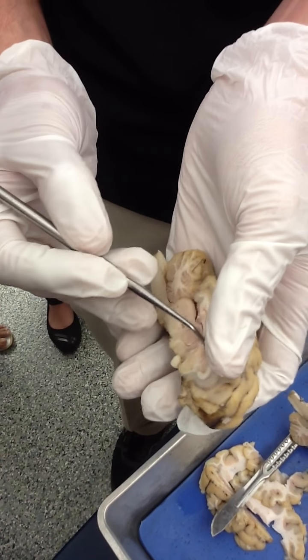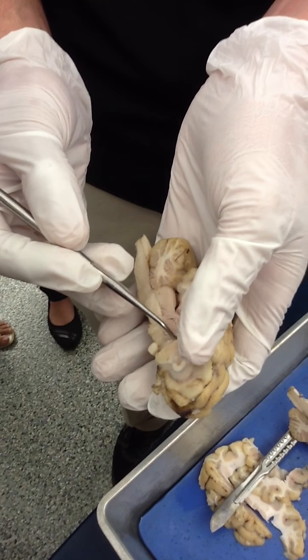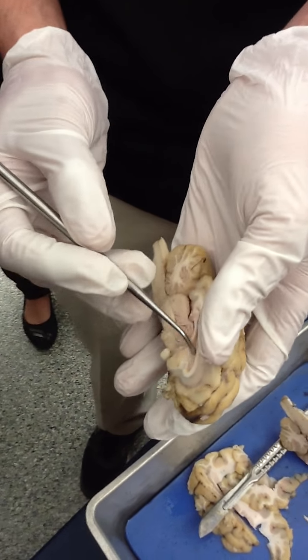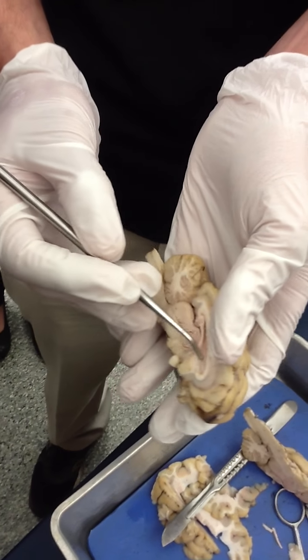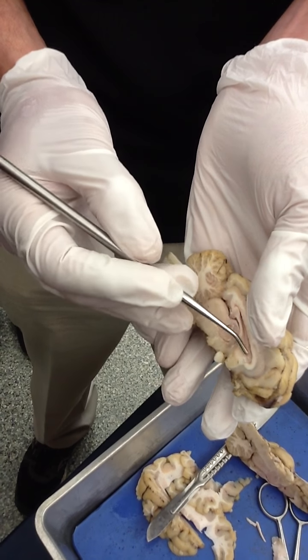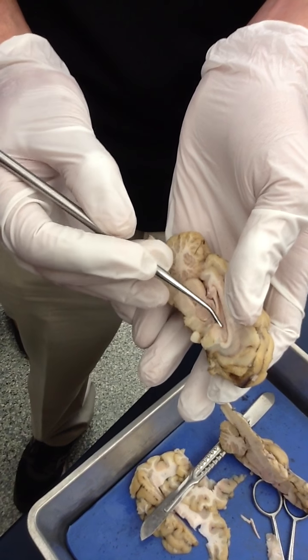Notice we can't see into the lateral ventricle on this half, and there's a thin membrane here — that is the septum pellucidum.